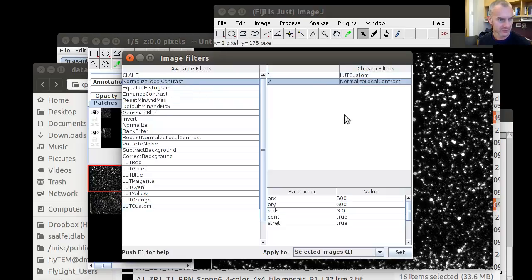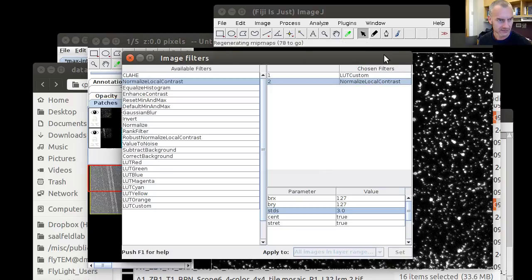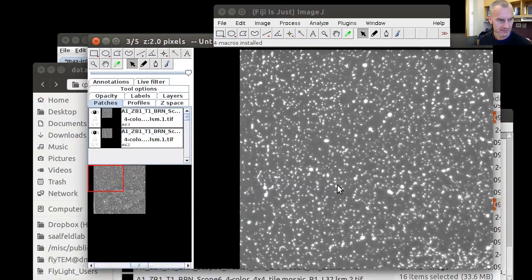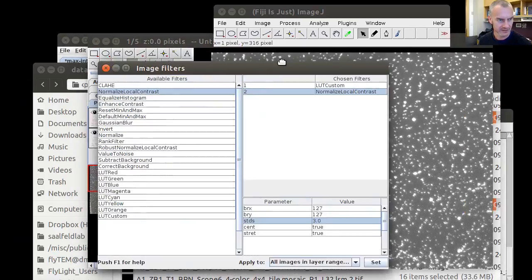And then we normalize the local contrast to boost the higher frequency information in these images that we're actually interested in. And we apply this to all images in all layers. That's the result of that. So all images are gray. We see the beads prominently everywhere. There's no dark place in any of these images.